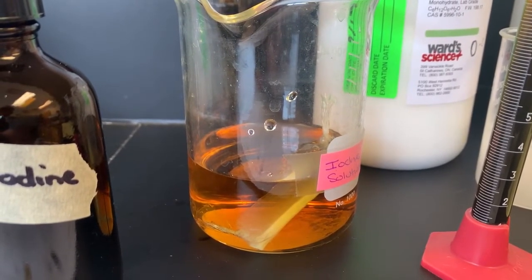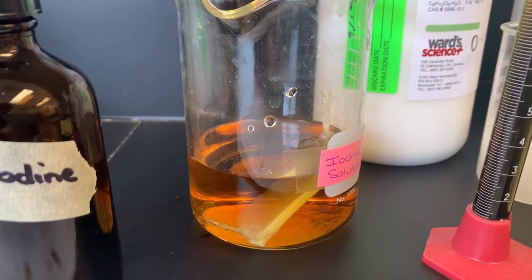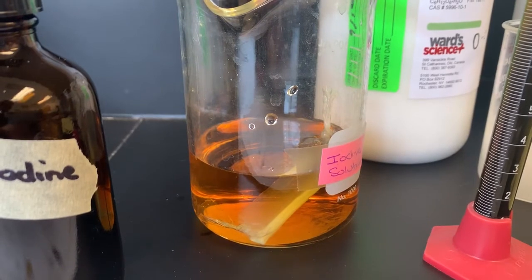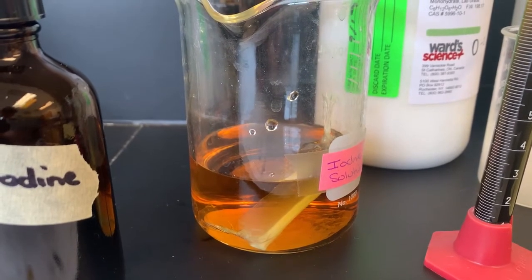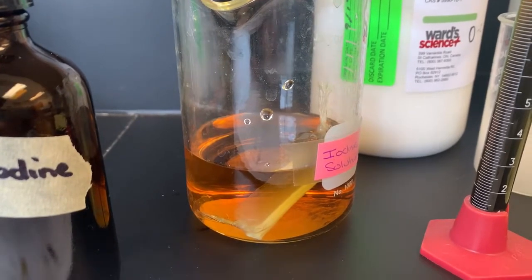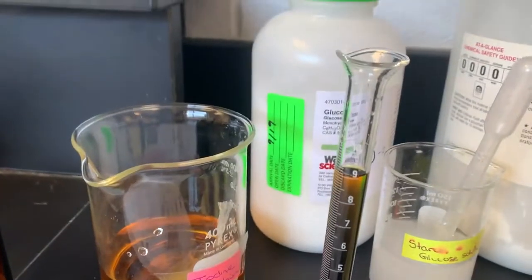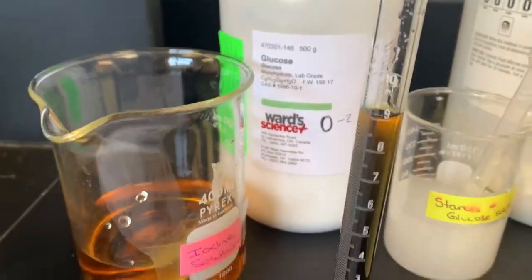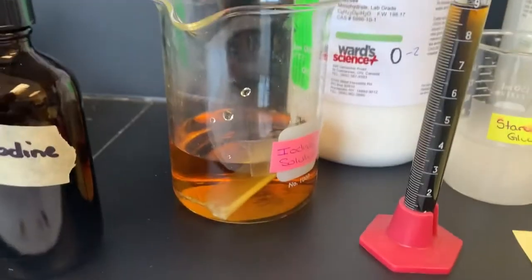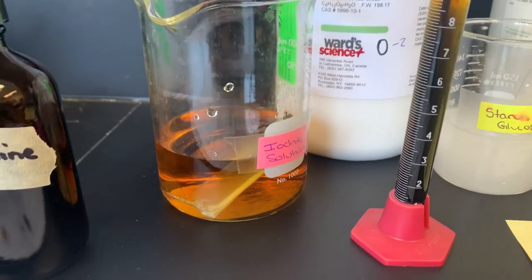And then we used our results from the starch and iodine to determine whether the starch molecule was able to move across the membrane. And for the next part of the lab, which you'll see in future videos, we also wanted to determine what happened with the glucose. So we tested that glucose later on using a different indicator, and you'll see that play out. It was called Benedict's solution.